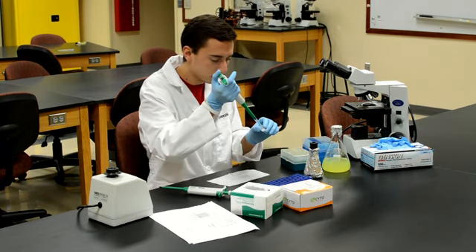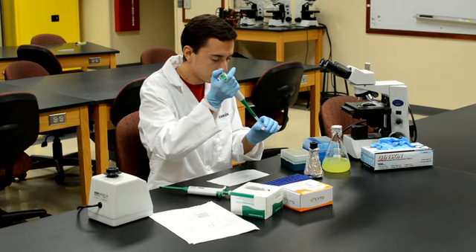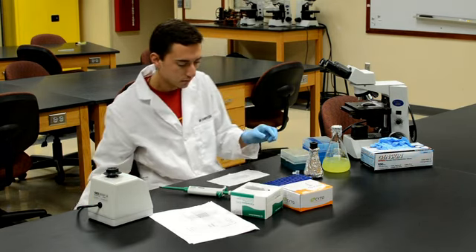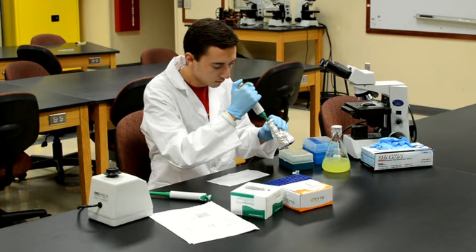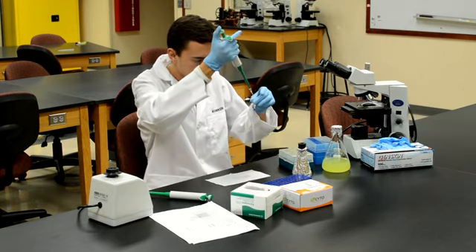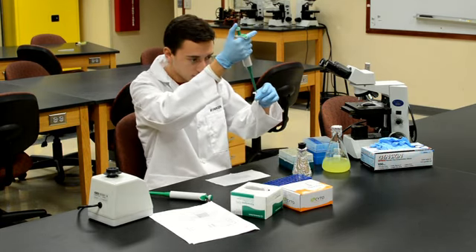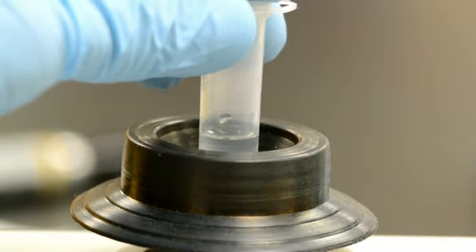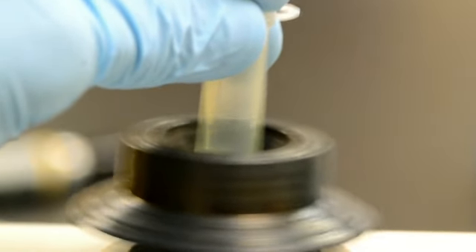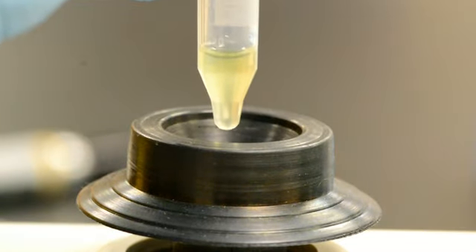Add your sample to the 2 milliliter microcentrifuge tube, then eject your tip into the trash. Add one drop of iodine tincture to your sample. Now close your sample tube and vortex it for a couple of seconds to mix the iodine into your culture. Iodine kills and stains the cells so that they are easy to count.